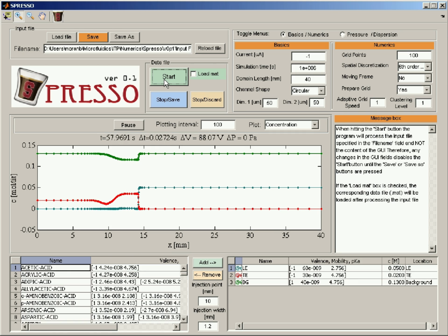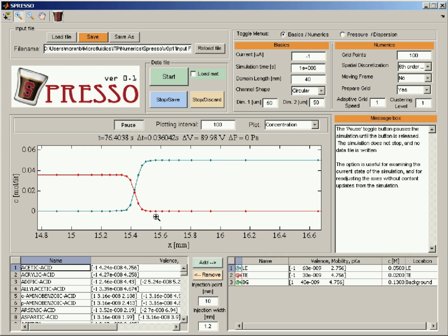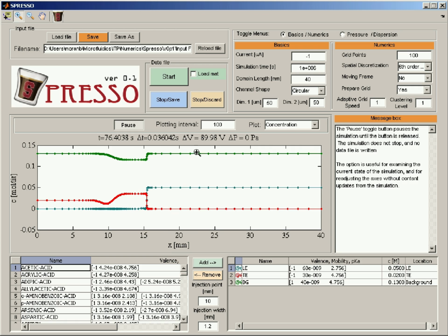So this is an example to show you the difference between the sixth order scheme and the second order scheme. I'll pause this for a second and zoom in on the area of interest. And you can see it's pretty smooth. There isn't enough resolution, perhaps more grid points are required, but at least it is stable. So in general, if you want accurate solutions, go for the sixth order scheme and not for the second order scheme, because it will be faster and it will be more stable for less grid points.